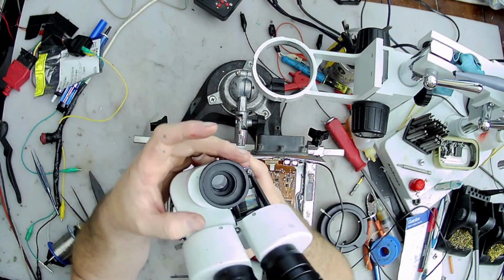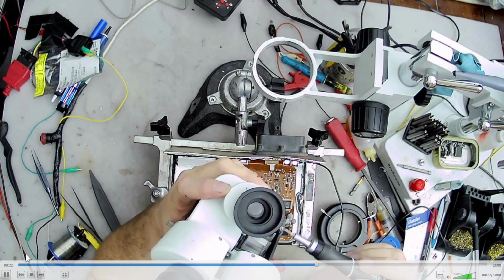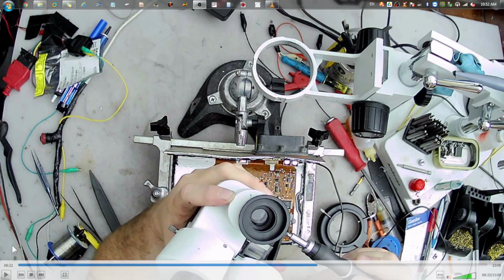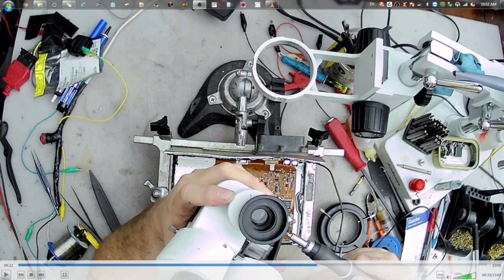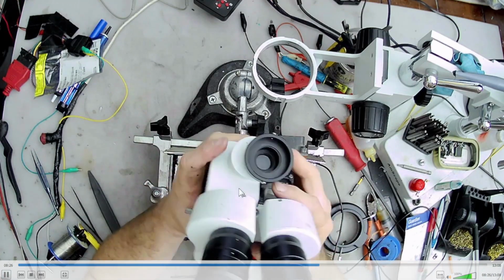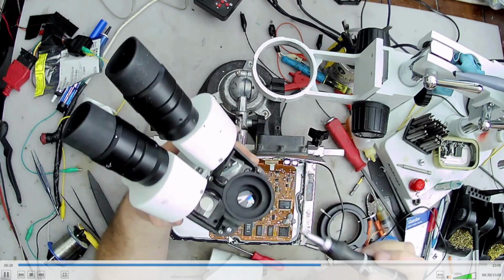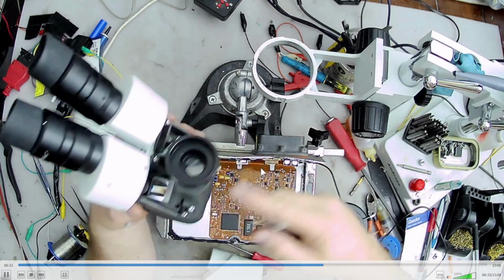Okay, so here I only have one mark because on my particular scope, mine only had one mark, but that's okay because this edge right here was one of my marks. I only had to mark here and here, and then one of my set screws was actually perfectly on this line, so that's why you only see one mark here. And now I had the one set screw tight, and now I just go around and I tighten this one, and I tighten this one over here.